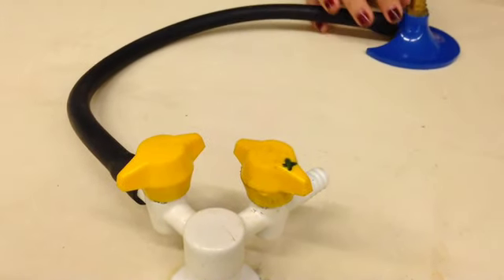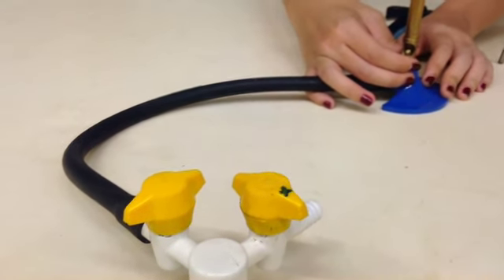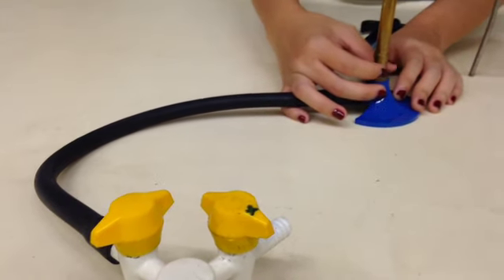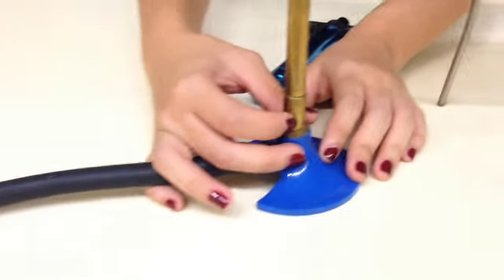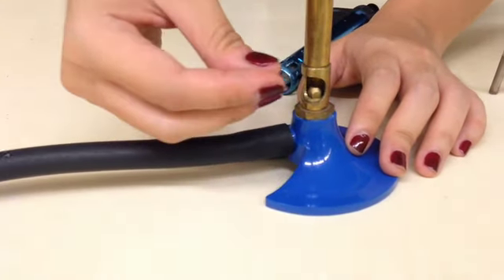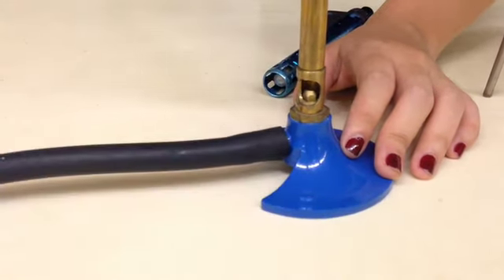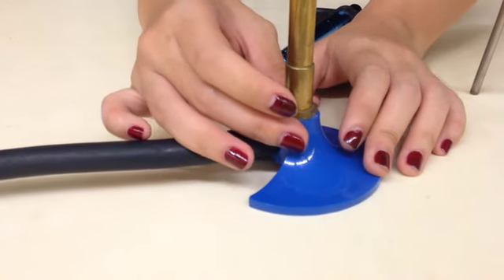Next, before you even start lighting, make sure that the Bunsen burner air hole is not like this. It should not be open. The air hole should always be closed. This is to prevent strike back. If there's strike back, the gas will come out through this air hole here, and you might end up with a fire coming out through this air hole instead of coming out from the top, which is what you want. So always make sure that the air hole is completely closed.